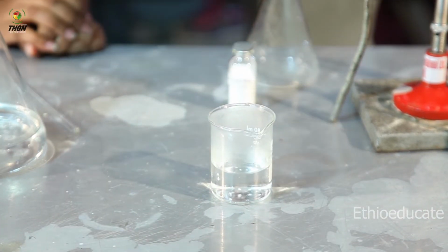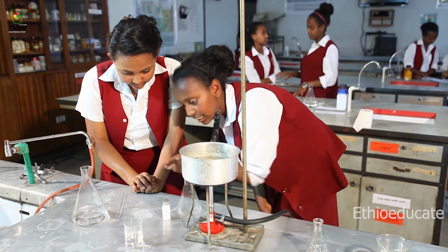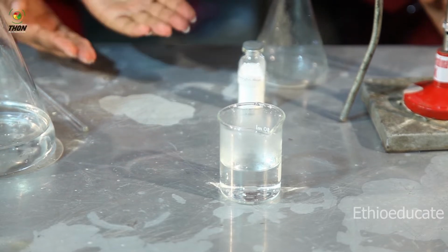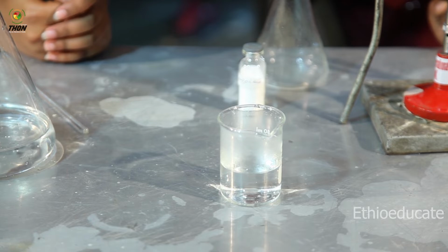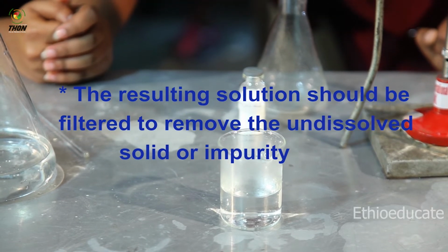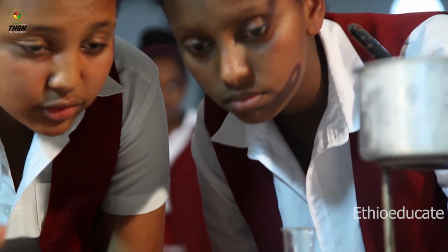Let's wait and see what happens. Okay. What is that white substance forming? It's not forming, but it's the substance that was not dissolved from the earlier experiment. Let me add a few drops of water.